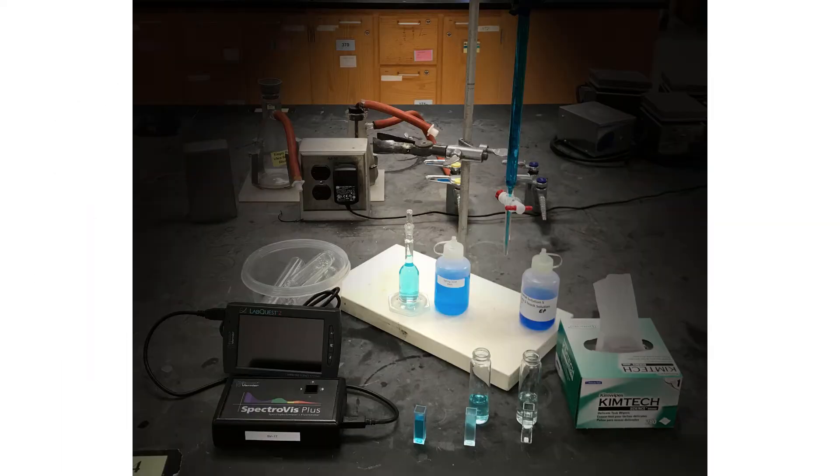You'll have your unknown solutions, multiple capped sample vials, a 25 ml volumetric flask, a burette, up to 3 cuvettes, and some kim wipes.